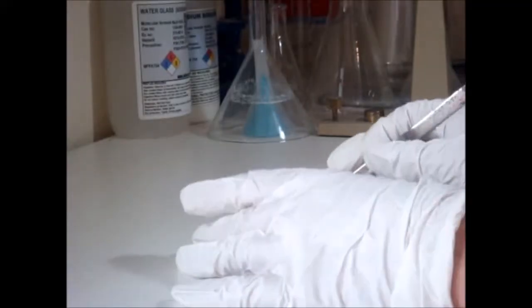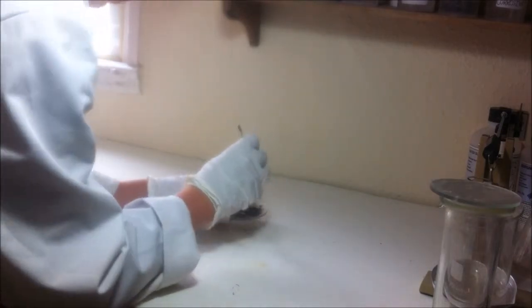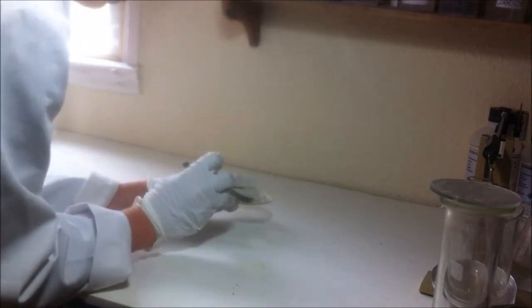During the recording I was a bit preoccupied so I'm doing a voiceover now. So I begin by adding a couple of spoonfuls of iodine and then one spoonful of the aluminum powder and mixing them together quite thoroughly. Then I start to move them into the middle, collecting them into one small pile in the middle.